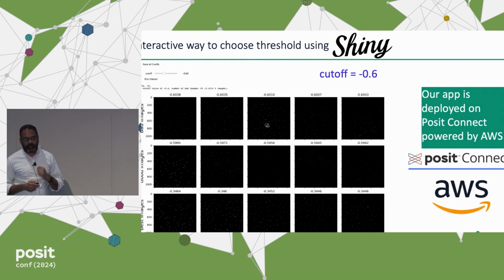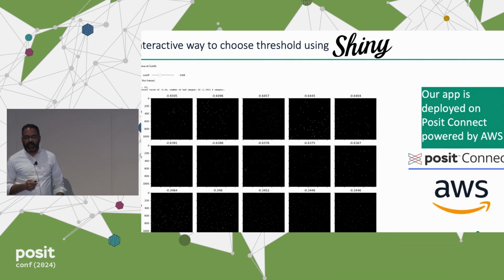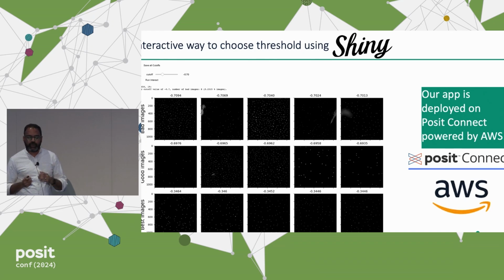You can adjust the threshold, and then you can see you get more images which are not great. So you can keep doing this until they're happy. As you adjust the threshold, it regenerates which images are getting flagged, which images are not great, and so on. So in this way, we could give them a tool, they could adjust the threshold, and they can see which images are getting flagged. And once they're satisfied, they generate a set of good images. By the way, this is all deployed using Connect on AWS. This allowed us to give them a lot of data, but still the app worked great.